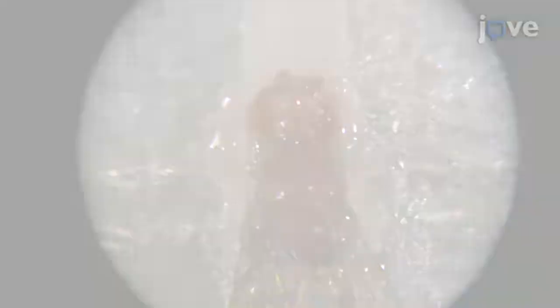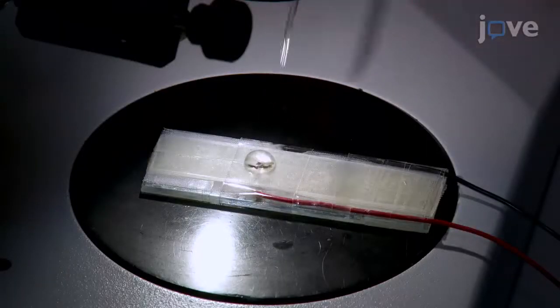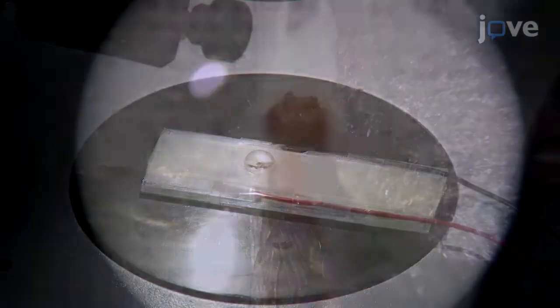When the glue is completely set, clear any residual unhardened glue from the dorsal surface of the fly head, and cover the exposed cuticle of the head with a drop of Ringer's solution.